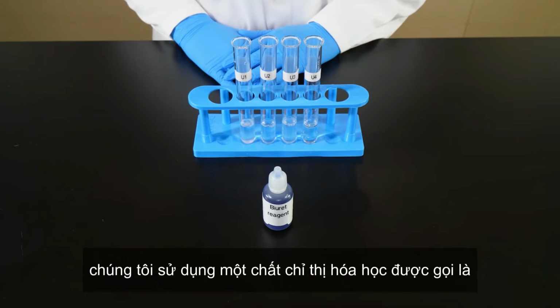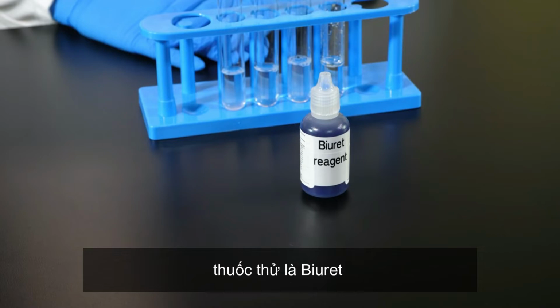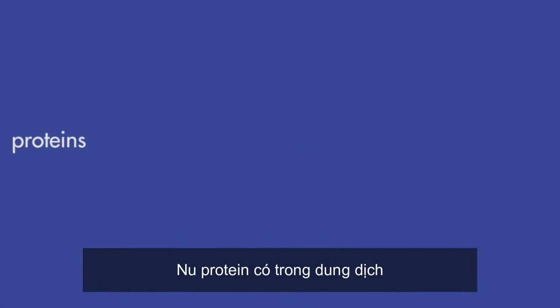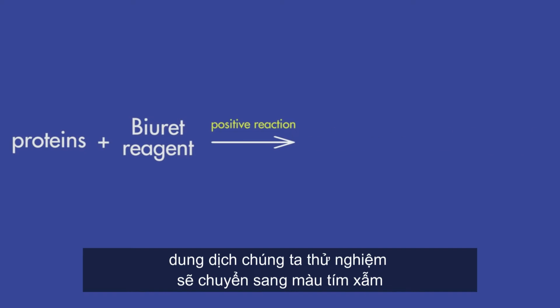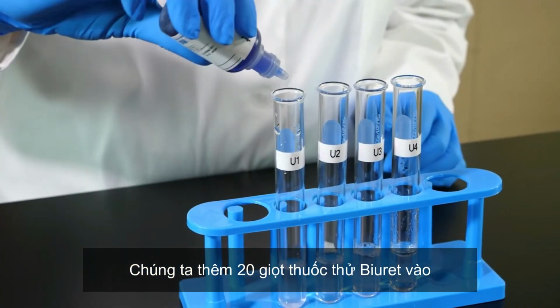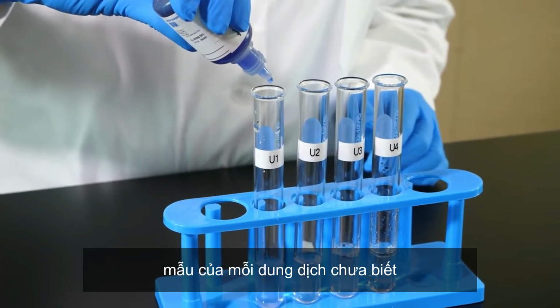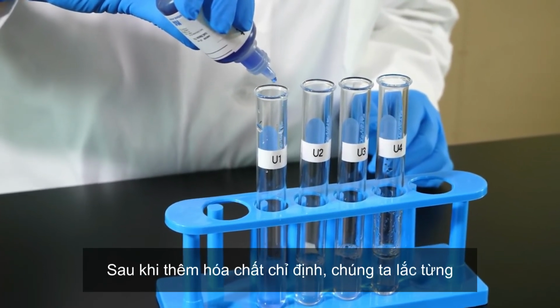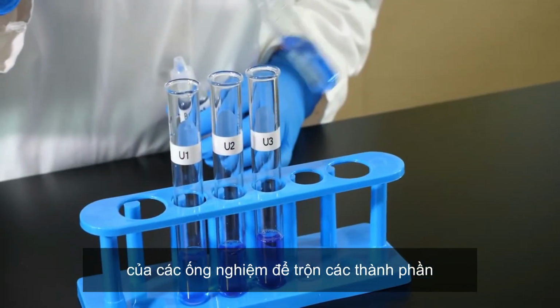To detect proteins in a solution, we use a chemical indicator called Biuret reagent. If proteins are present in a solution, a positive reaction between Biuret reagent and protein will occur, and the solution we are testing will turn dark purple. We add 20 drops of Biuret reagent to a sample of each of the unknown solutions. After adding the indicator, we swirl each of the test tubes to mix the contents.